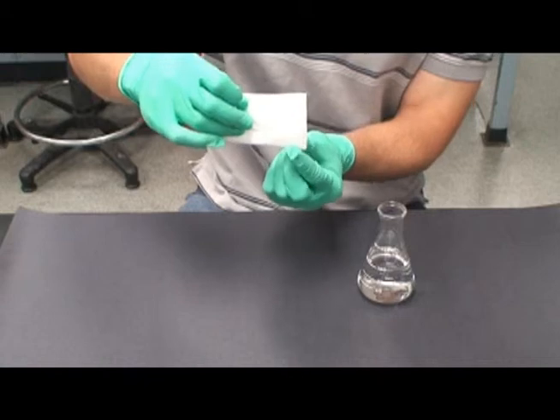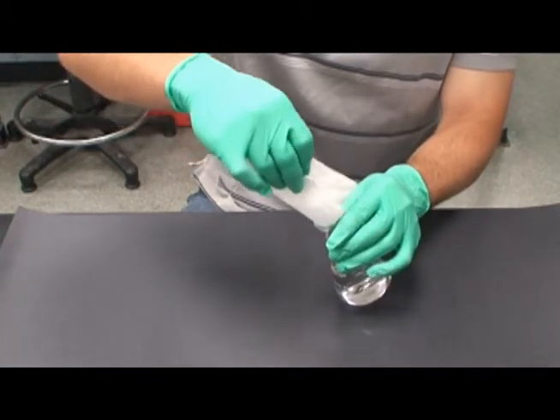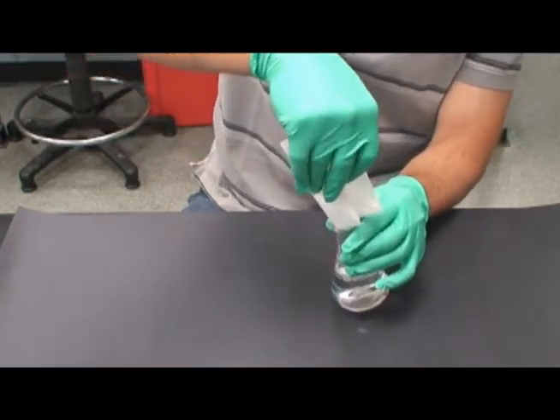Make sure all the agar gets into the flask. The flask is now to be microwaved to melt the agarose into the buffer.